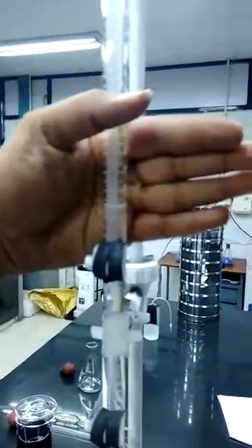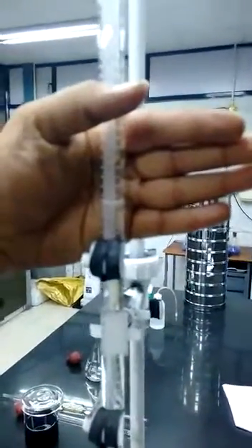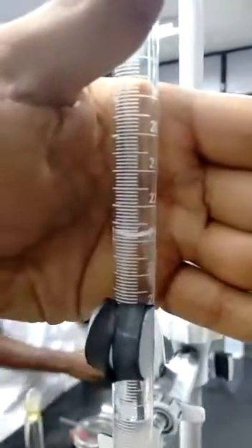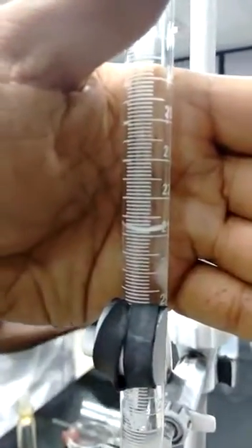It has come 23.9. The value has come out to be 23.9. Stir it well.